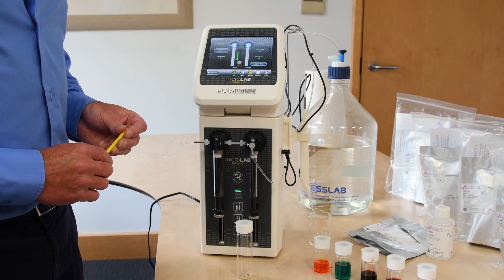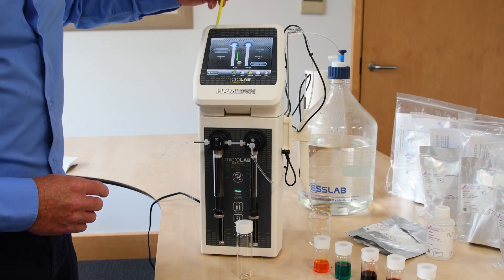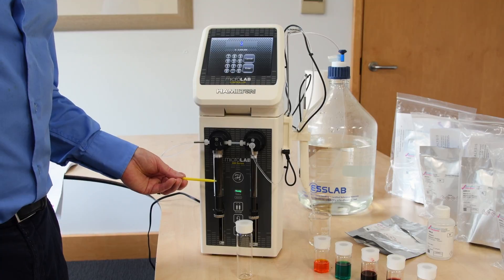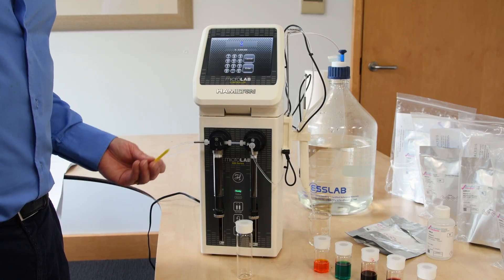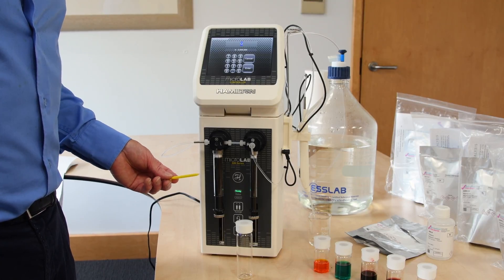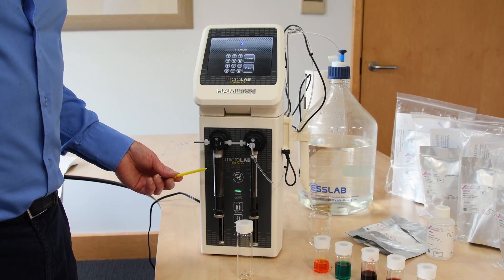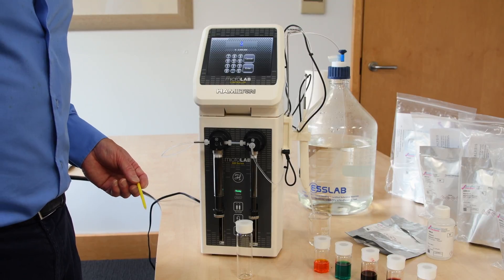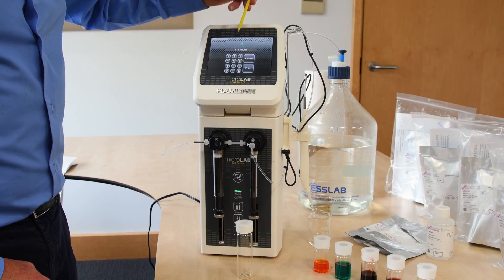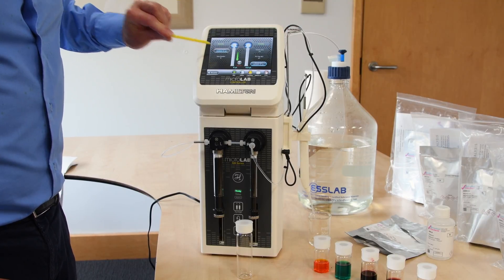As part of preparing a standard, we first determine the total volume we wish to prepare, which is selectable in this mode. The syringe in place here is a 10 mL syringe. The syringe can cycle the number of times required to make the total volume, and we can select syringes on the diluent side from a 1 mL syringe right through to a 50 mL syringe. We're going to make a total volume of 25 mL, which we enter here.